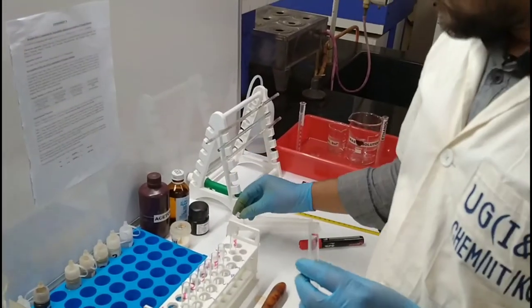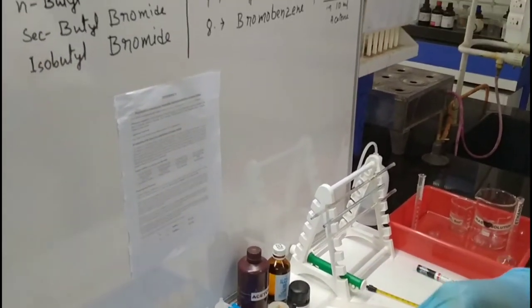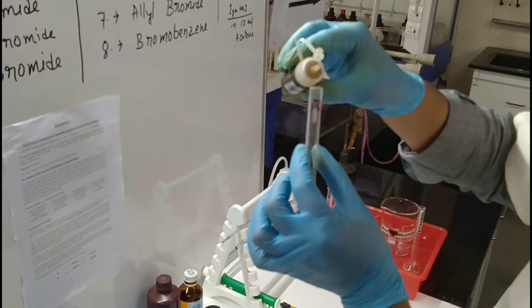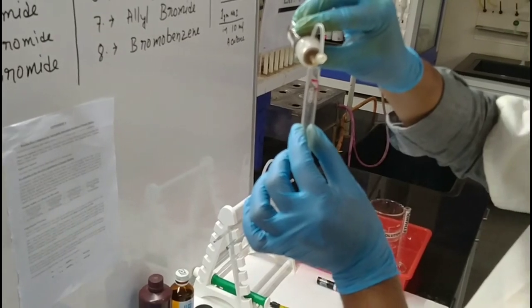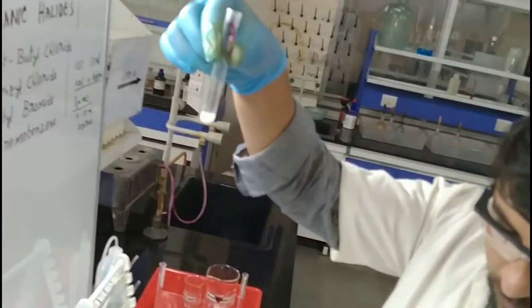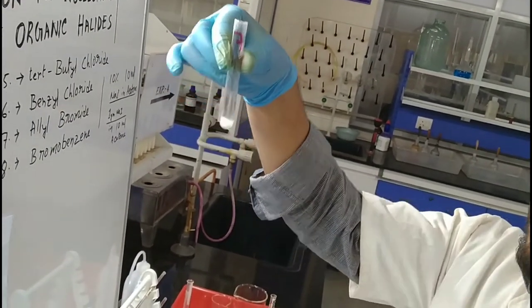Now we are going to perform the 7th one — allyl bromide. I am going to add the 7th halide inside the 7th test tube: 1st drop, 2nd drop, 3rd, 4th, 5th. As you can see, instantly precipitation comes when I just add it. So for this test tube, the precipitation comes instantly. This one is also over.